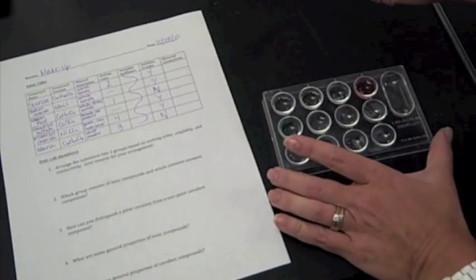So, the last thing that we're going to do is the electrical conductivity, and we have these conductivity testers here. As soon as I plug it in, you'll see that the light might or might not come on. There it goes. But it's not flashing, and that's the key. If it's flashing, then that's a positive test for conductivity. And when it's not flashing, that's a negative test. So, we're just going to put it in each of the water solutions and see if it conducts electricity.